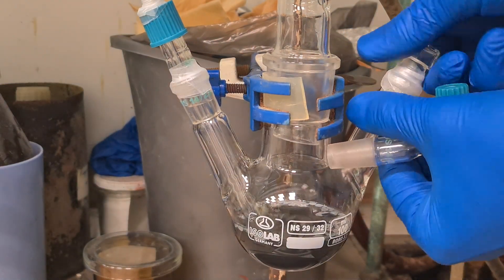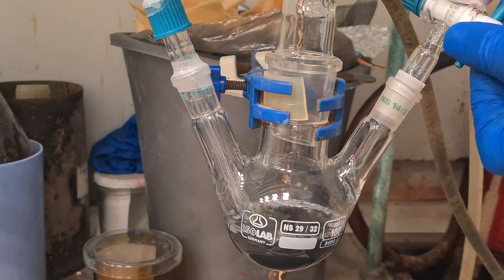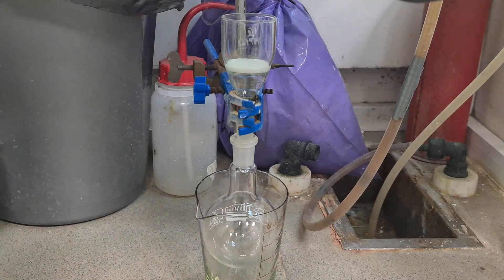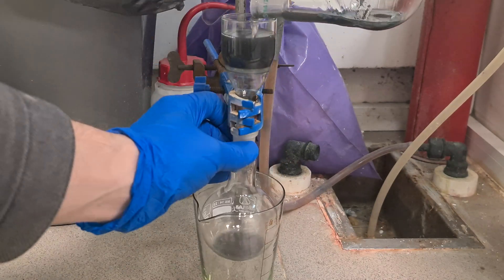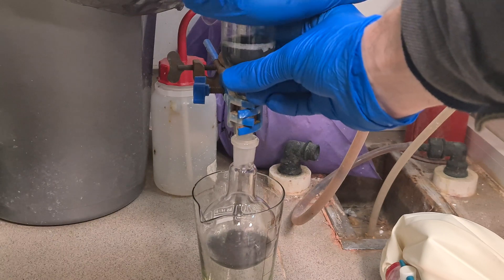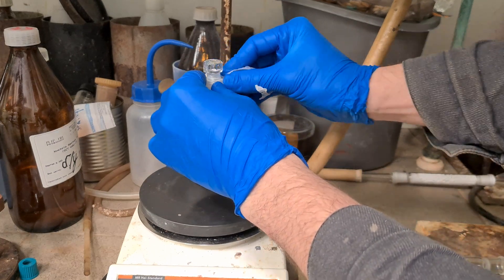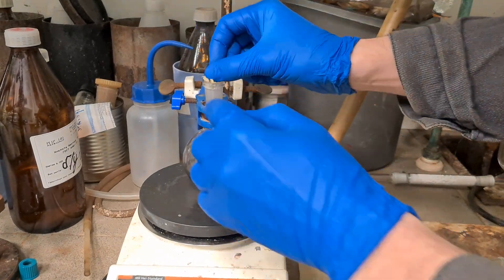Next, connect another argon balloon instead of the stopper and a glass stopper instead of the reflux condenser. You will filter the lithium t-butoxide solution through a 100-pore fritted glass filter by hand into a 100 ml round-bottom flask purged with argon — do it as fast as possible. This solution could already be used in some reactions at a concentration of about 2.8 molar.